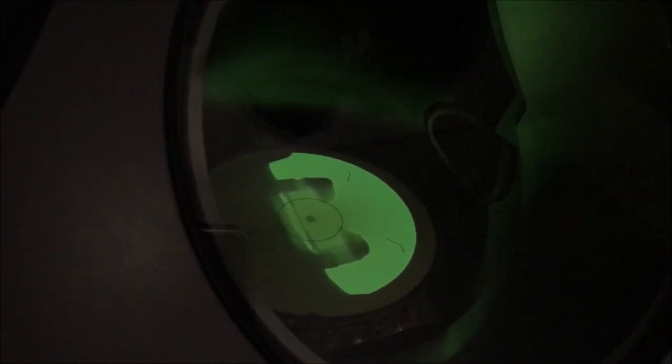One way to verify that the eucentric focus is actually correct is by simply turning on the alpha wobble again and seeing if the image doesn't shift while the alpha tilt is wobbled. Turning on the alpha tilt, we see the image is basically stationary, giving us the same result as the mechanical tilting method. Also important: your height is only eucentric with respect to the alpha tilt axis. If you're using a double tilt holder and adjust the beta tilt, you're no longer at eucentric height and will need to reset it. This is where the eucentric focus method — adjusting z until contrast is minimized — is helpful, as you don't have to wobble the alpha tilt and possibly alter a tilt condition you've set up.